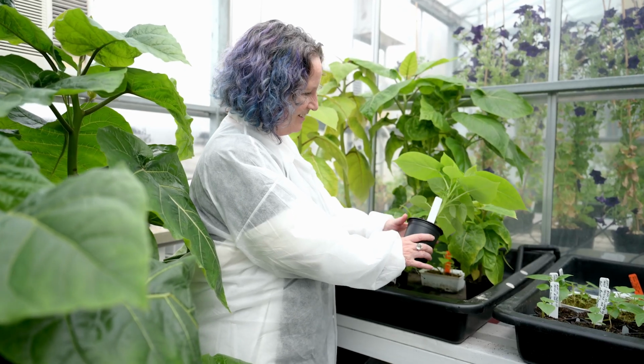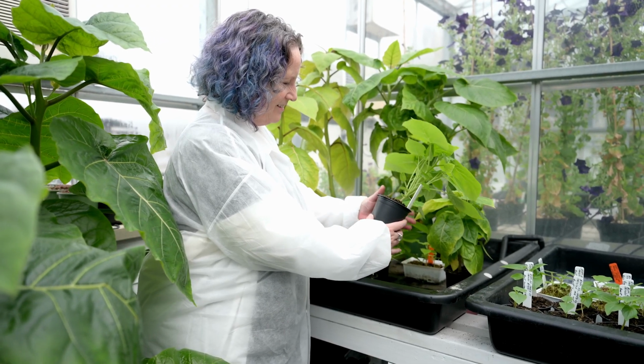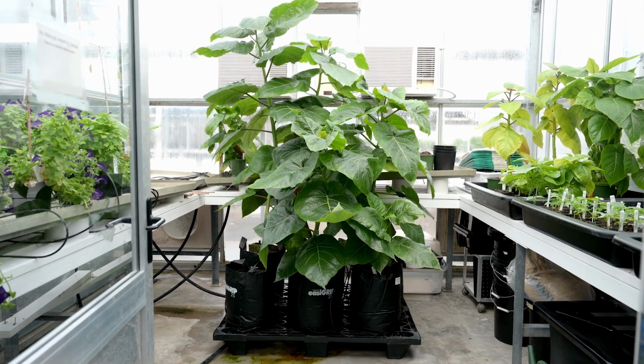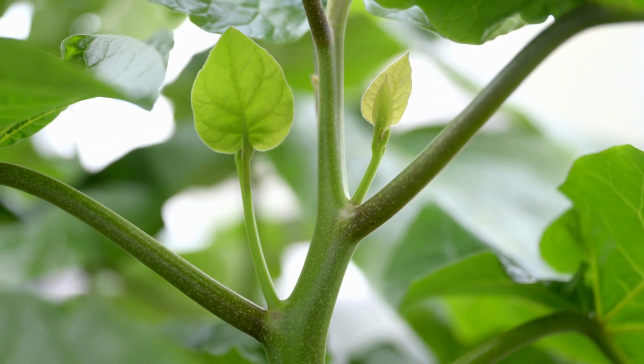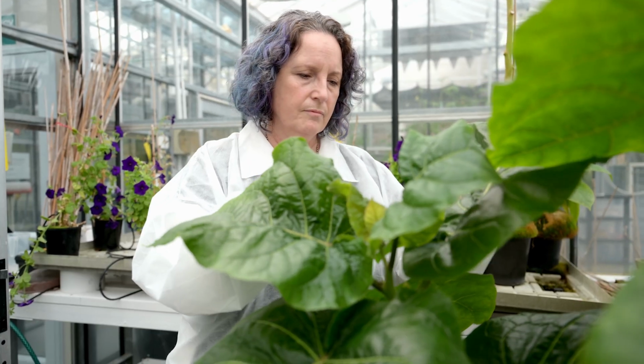So once we've done all that work in the lab, we will know which plants have edits and which ones don't. And we can go to the plants in the glasshouse and compare those plants and look for changes to their growth and development. As an example, I have some plants behind me, they're tamarillos, and we have some that are not edited and they are tall and have no branches. And then we have edited plants and they are a bit shorter and they have increased numbers of branches. So that will overall affect how we can manage those plants. We can grow them more crowded together and increase the yield.